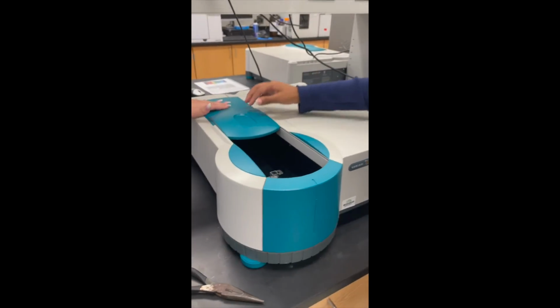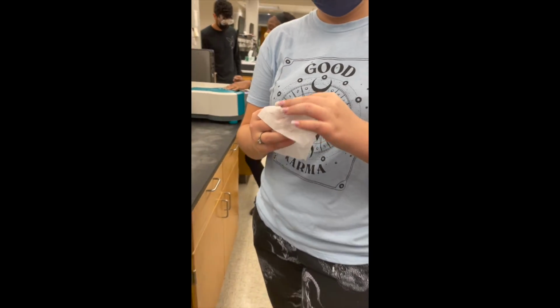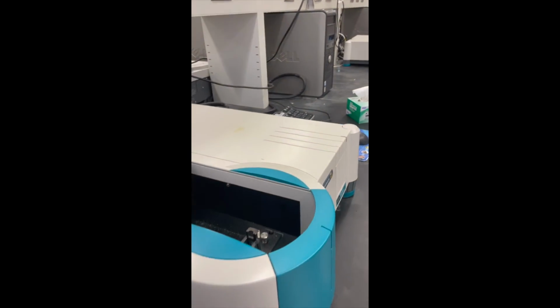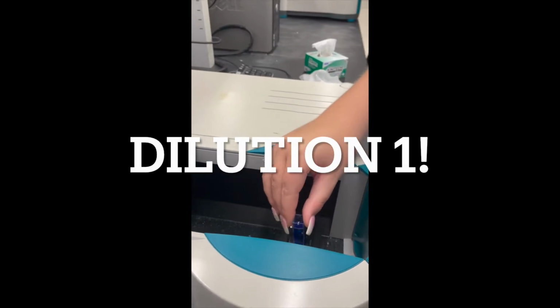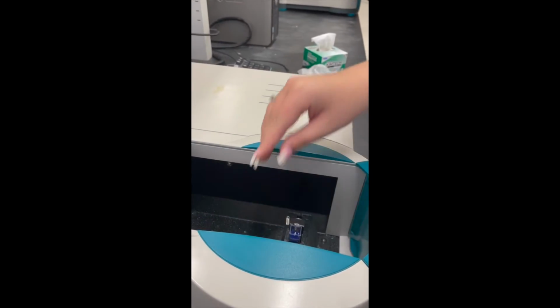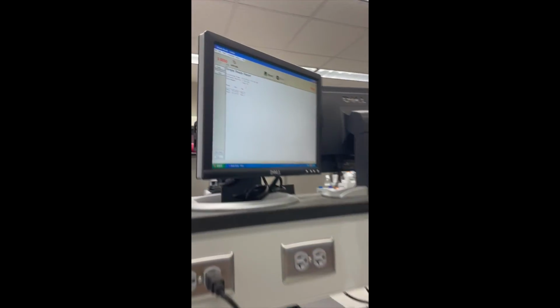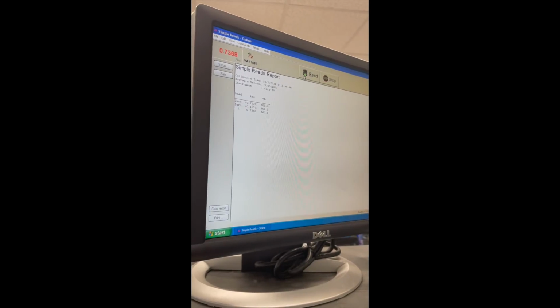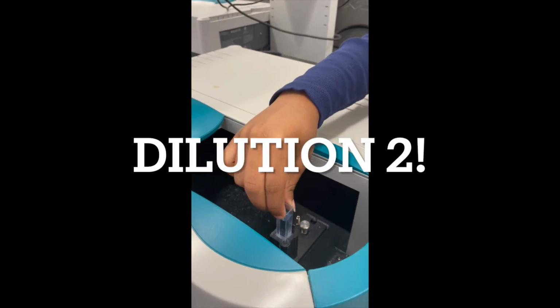The Beer-Lambert law states that the relationship between concentration, molarity, and absorbance of the solution is linear. The variable A means absorbance, E means molar absorption coefficient, C is the molar concentration, L is the path length, and the blank being zeroed will cause any light being absorbed by the solvent to be neglected. In this case, the solvent is the NH3 molecules.